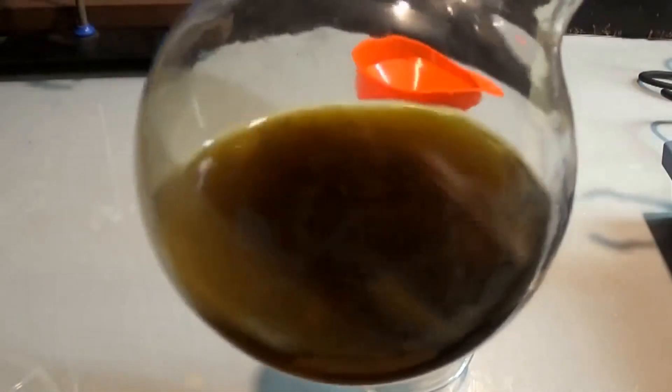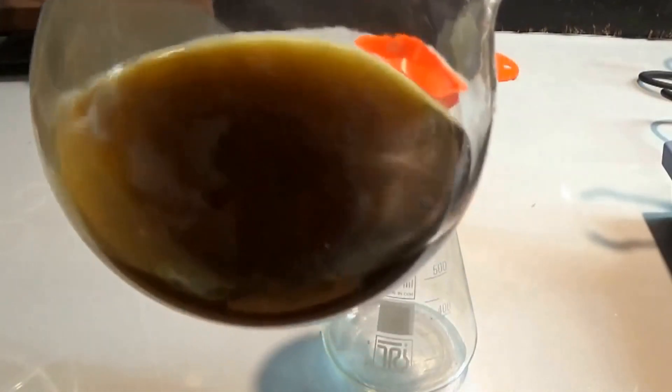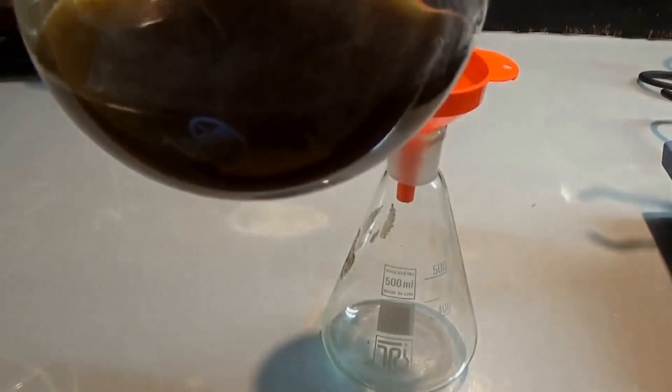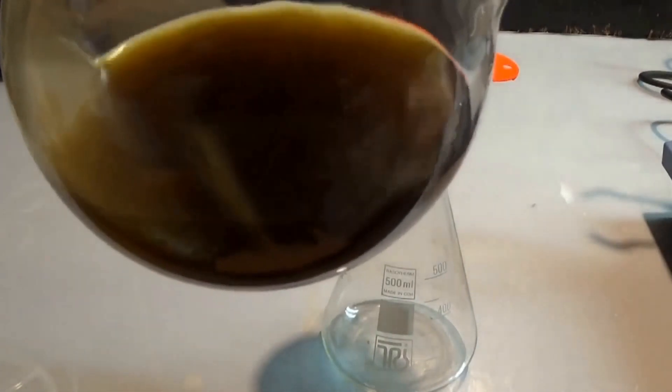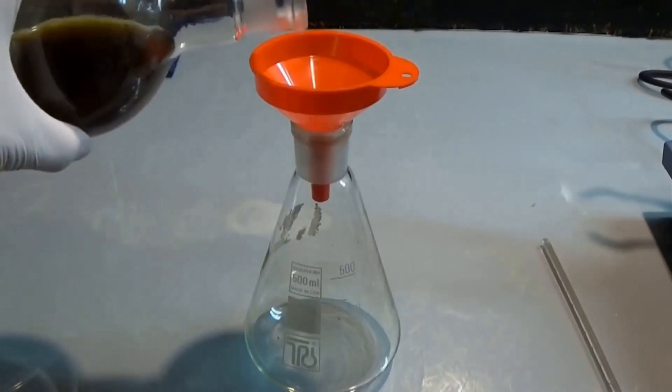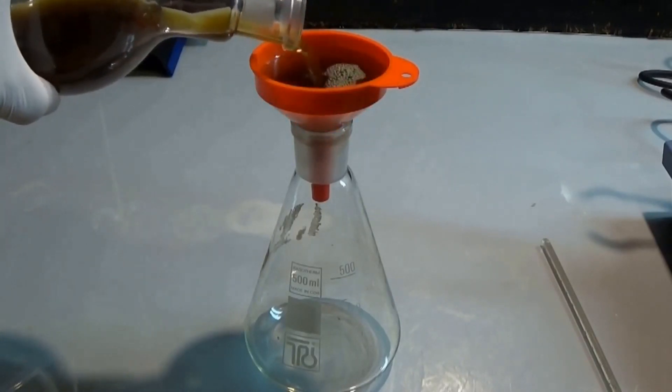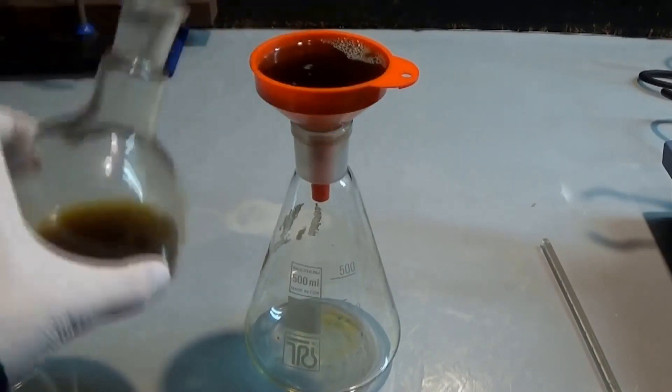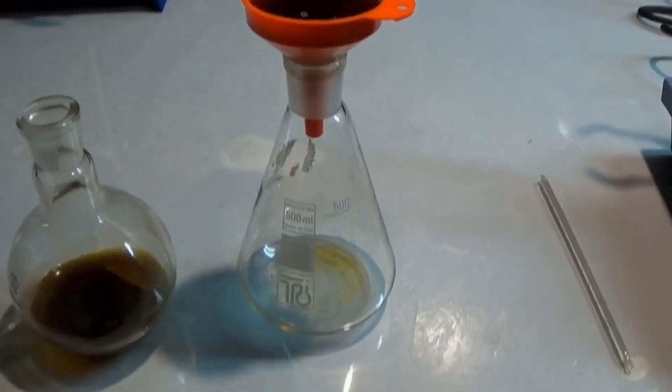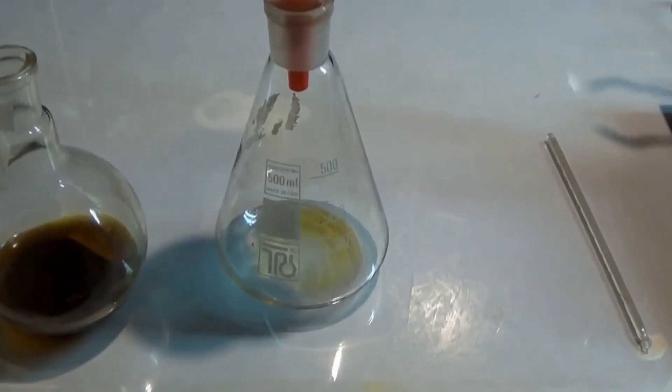Again, there is room for improvement. In this case, I recommend to distill off all of the ethyl acetate using a water bath. The water bath is used to distill to dryness without the risk of burning the crude product. The crude product is then solvated in warm ethanol and the process is continued as normal.